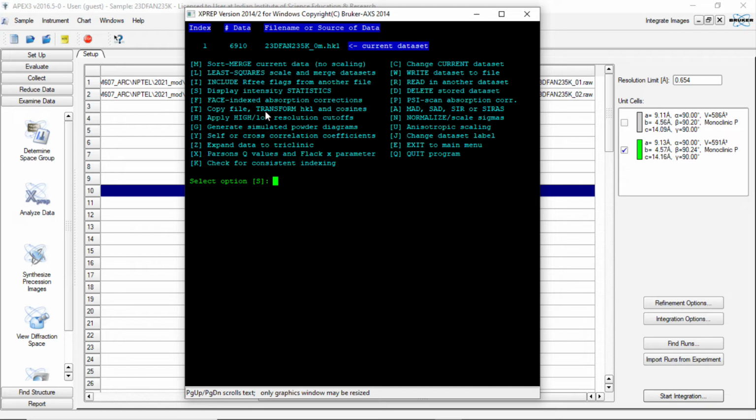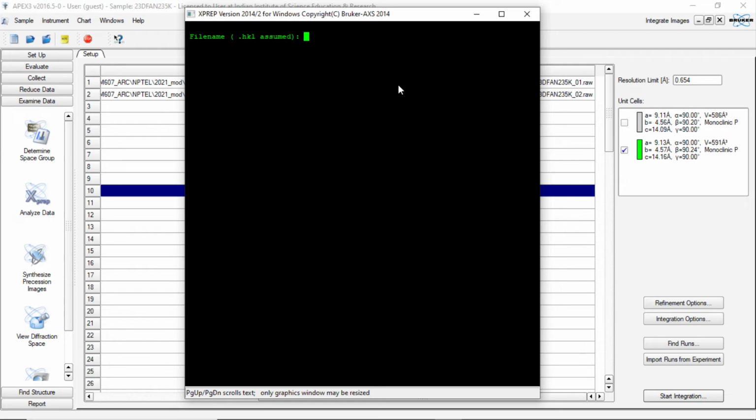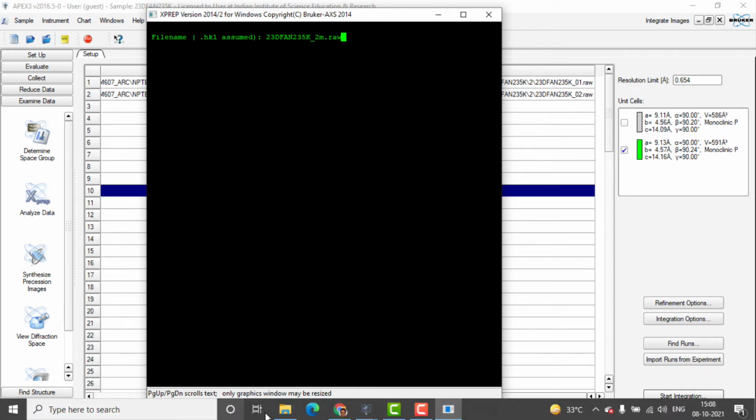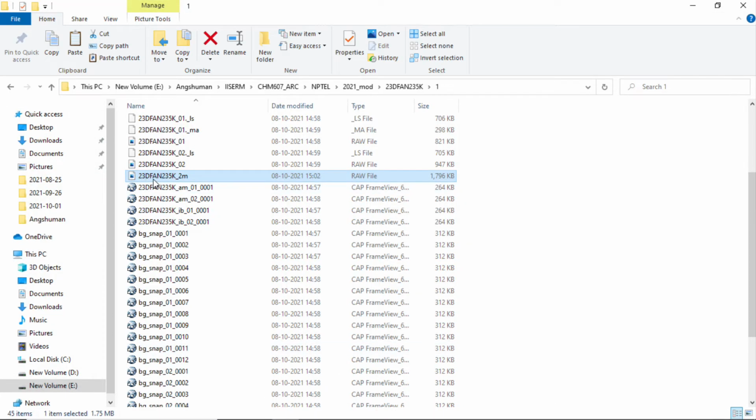So here we can read another dataset by typing R, and here it is asking what was the cell settings. It is the original cell settings, not the current cell settings. Now it needs the file name. What is the file name? File name is 23DFAN 235K underscore 2M.raw. So this is the file name it is supposed to read, because this is the file which we copied. This is the 23DFAN difluoroaniline 235K underscore 2M.raw.